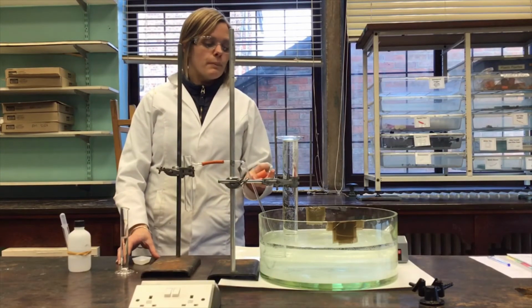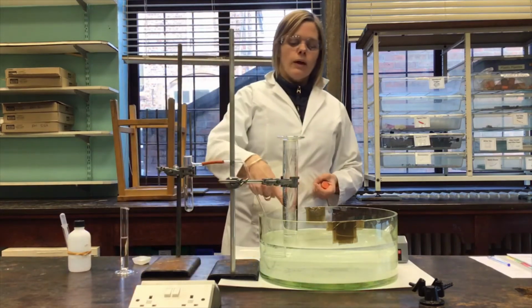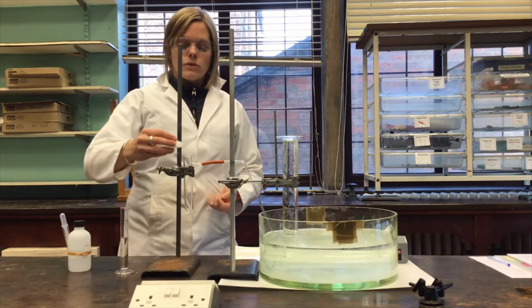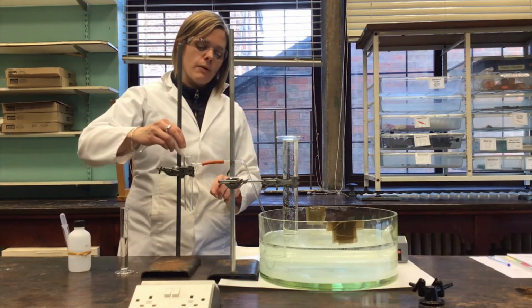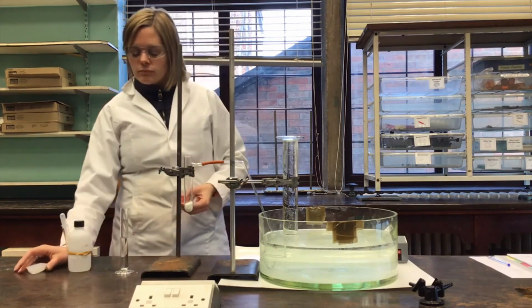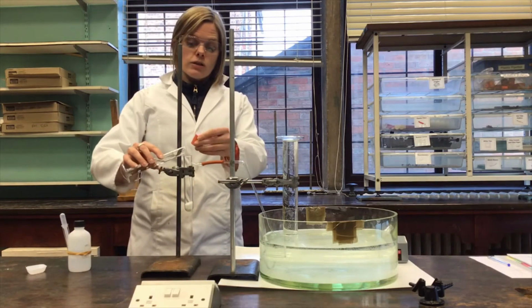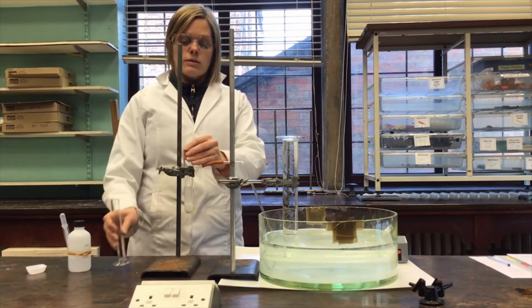This is a second example of monitoring rate of reaction by continuous monitoring. So in this example, instead of a gas syringe with a scale, there's a measuring cylinder here with a scale on it. The instructions say to add about 10 grams of small marble chips to the sidearm tube, this thing here. So I'm going to pop those straight into there like so. And then to add 20 centimetres cubed of 1.0 moles per decimetre cubed hydrochloric acid and replace the bung really quickly. So I shall do that now. So put that straight in there like so, stick the bung on it like that.